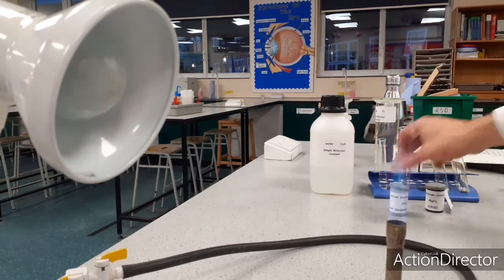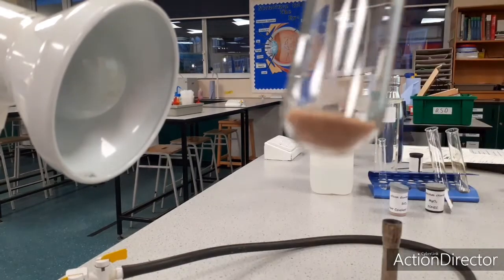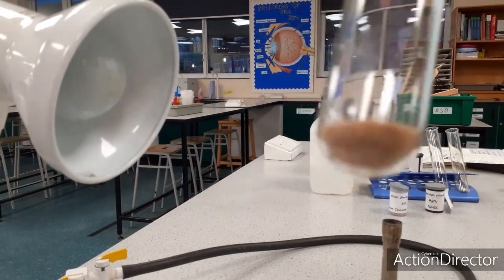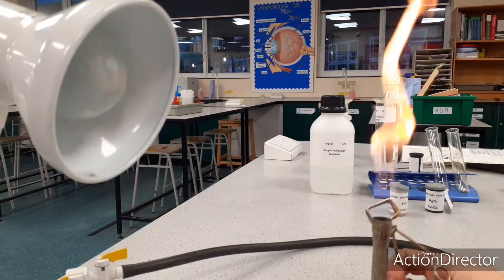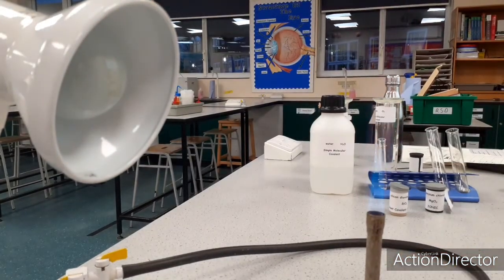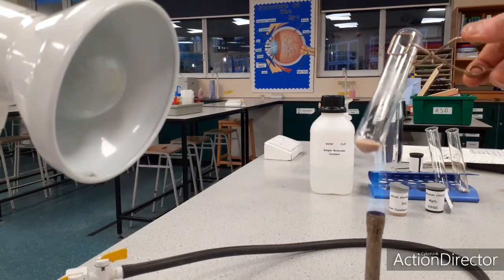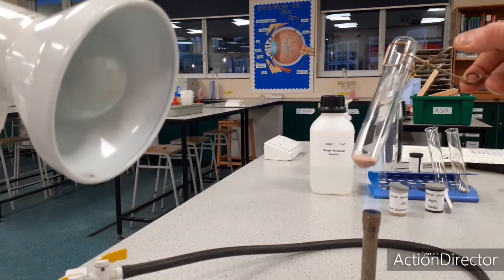Moving on to a giant covalent substance. Okay, back to my safety flame again. The giant covalent substance I've got is silicon dioxide, which is similar to diamond. And I've got my safety flame on. Remember, a yellow safety flame means I'm getting incomplete combustion, and I want a hotter flame, complete combustion now. I've opened the air hole, and I'm just getting carbon dioxide and water in the flame, but let's not focus on the flame.